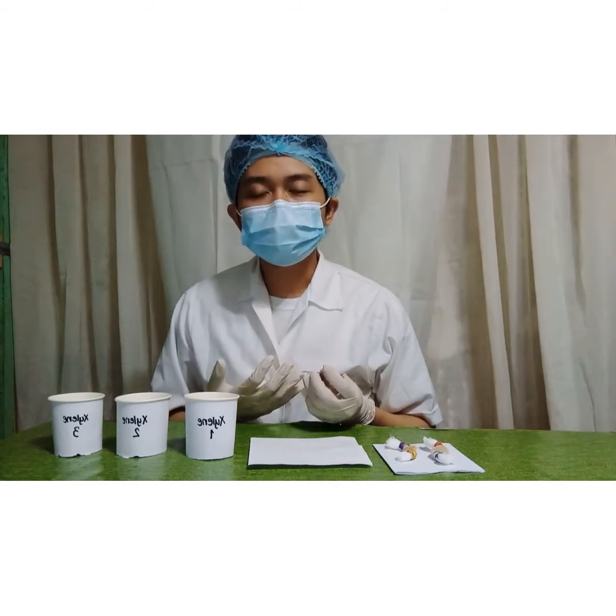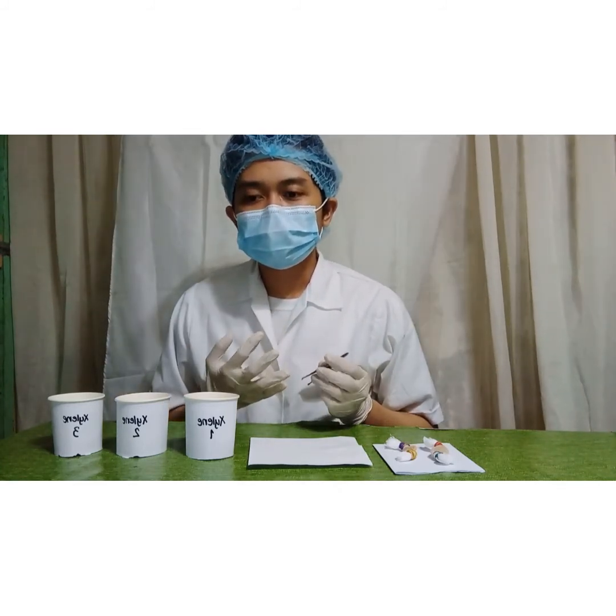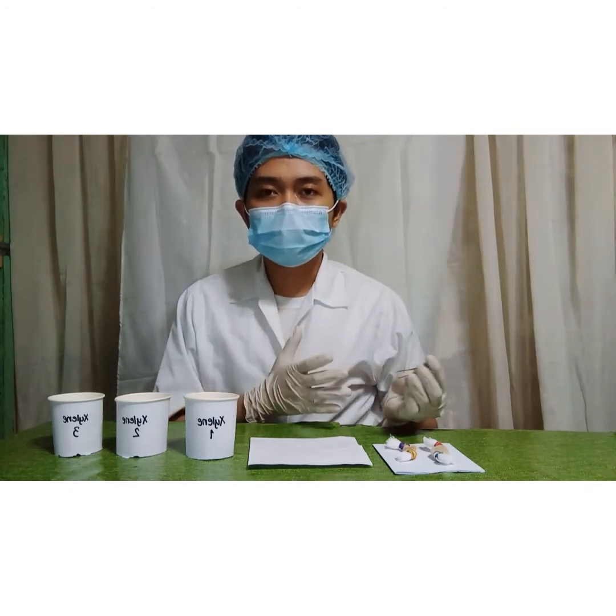Since we submerge the tissue in ethanol during the dehydration phase, it is necessary to remove the alcohol from the tissue through a process referred to as clearing. The alcohol is removed with a fluid that is miscible with the paraffin wax with which the tissue must be impregnated. The procedure is known as clearing because the tissues are rendered translucent in addition to being free of alcohol, since the refractive index of the clearing agent is nearly equivalent to that of tissue proteins.